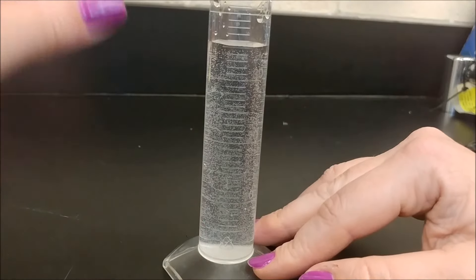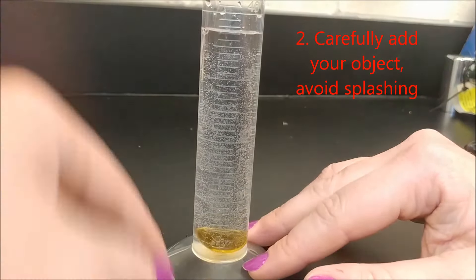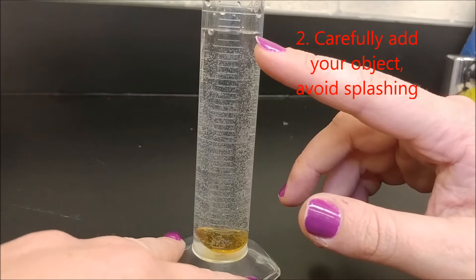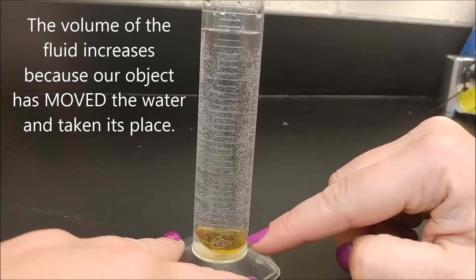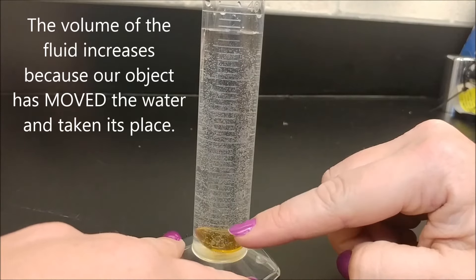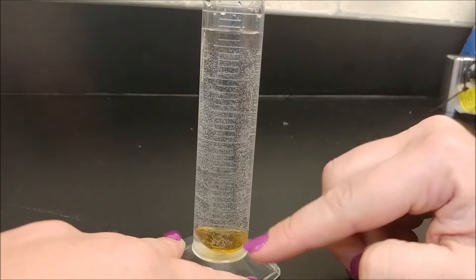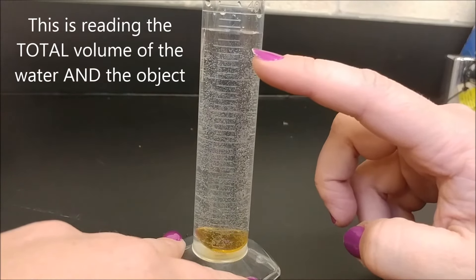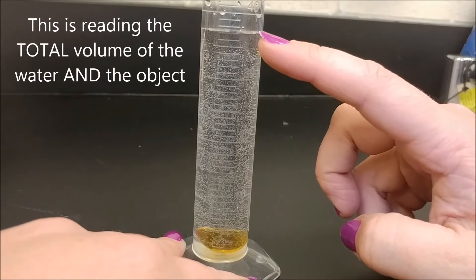I'm now going to drop in this pebble. Notice that the volume level has increased. It's not because I've added water — it's because this marble is taking up space in this graduated cylinder. So it's displaced, or moved, the water molecules. So now we're reading more water in here. I was at 35 and now I'm at 37 milliliters.